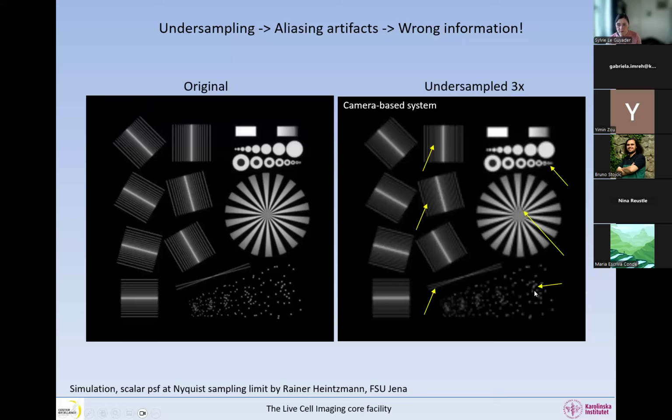And then when we look here, if you look at what corresponds in the other image, you can clearly see that there are 3 dots, but here they are sort of fused to each other. And we could look at this one here, it's on its own, but anyway, it looks elongated. And even if this one is far away from the others, it anyway looks fused. And when we look at these 2 dots, in this image they have the same intensity, but here they don't. One is much dimmer than the other. So all these are aliasing artifacts that are due to the undersampling.